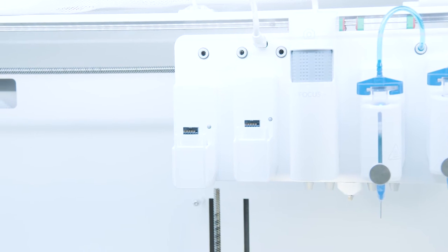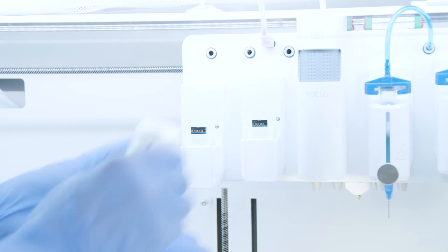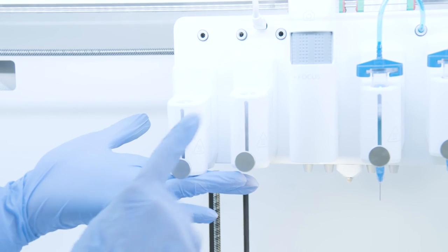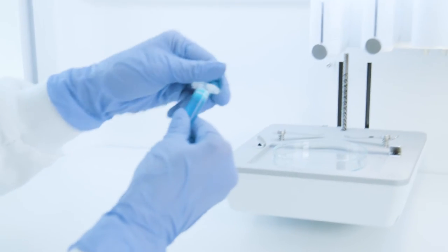So let's go through the preparation steps. First, we should assemble the pneumatic printhead on the device. It's important to know that only the first and second printhead slots are designed specifically for coaxial extrusion in the Bio-X6, and not the others.